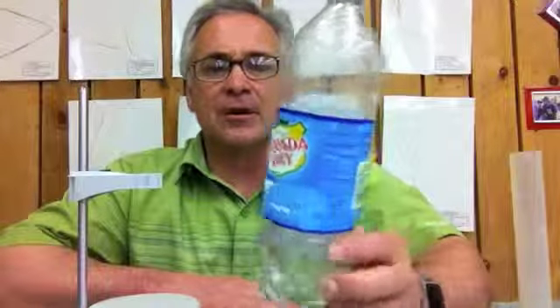Now, one of the things you're going to have to do is come up with a hypothesis, and we're going to be comparing two different kinds of solutions. We're going to take a look at just plain water, and then we're also going to be taking a look at club soda. This particular brand has a variety of different solutions in it, and you are going to be testing these solutions plus water, and which one makes a better buffering solution.